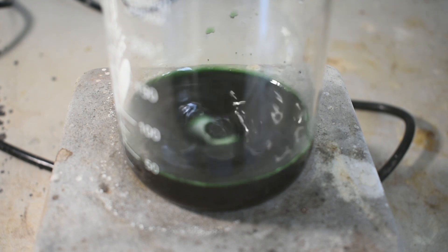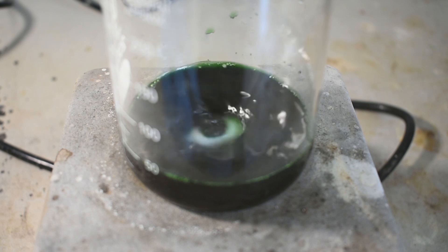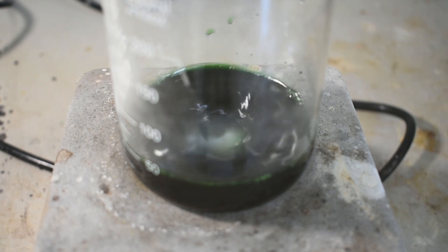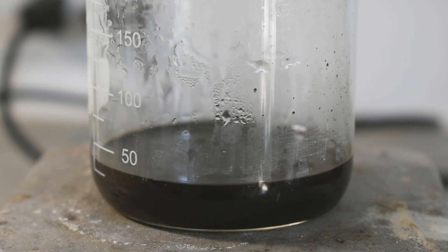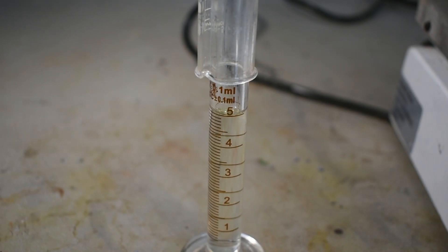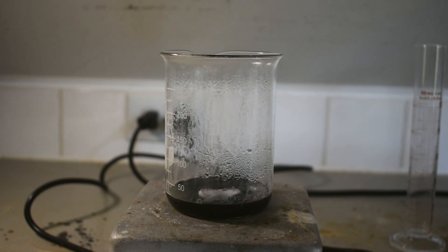With good ventilation, I should add. At this point, 5 mL of anhydrous ethylenediamine are measured out. According to the procedure, the ethylenediamine is added dropwise to this still-hot solution.